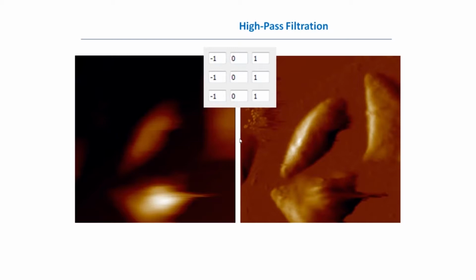Another example of kernel spatial image filter application is high pass filtration. How can this be used? From the left side here, you can see the image which has some big objects, but we cannot see details at all. And if we use another filter, which is actually the differential filter, that means that for the central point, we are getting the gradient in the horizontal direction. As a result, we see the x derivative of the image from the left, and we can see the features which were hidden on the left side. So this is an example of how high-pass filtration can help us.